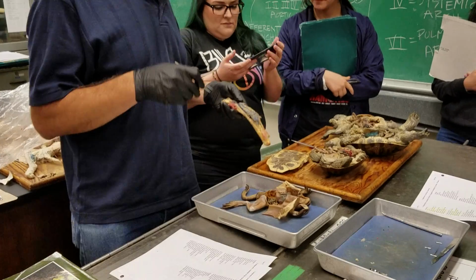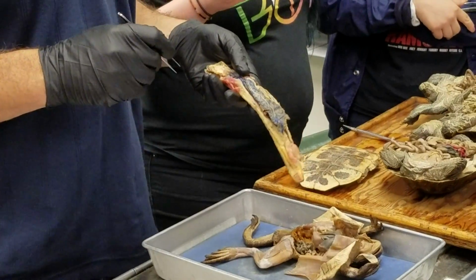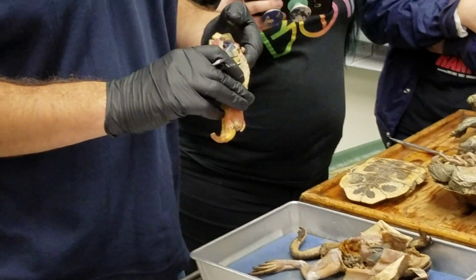That's probably all you would like me to do with an Necturus. Yeah. And what animal is this? Yeah. That'd be great. Does it have a circulatory system? Yes. Where's the heart? Where's the heart?